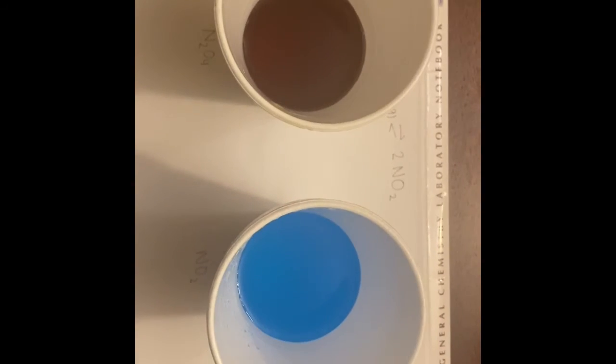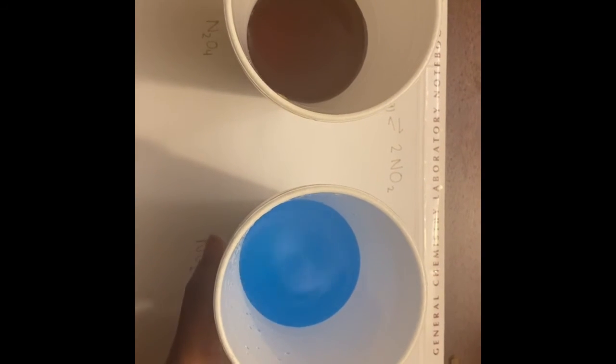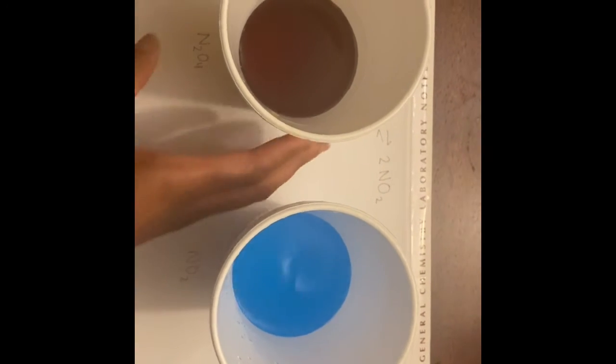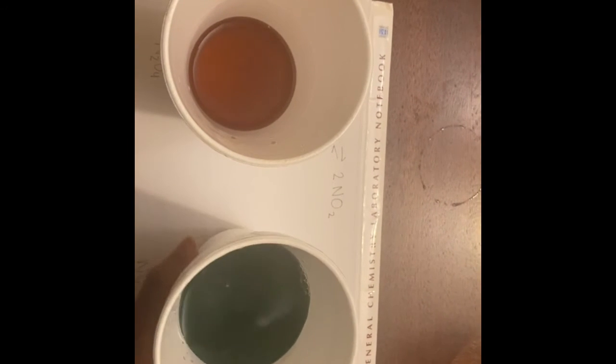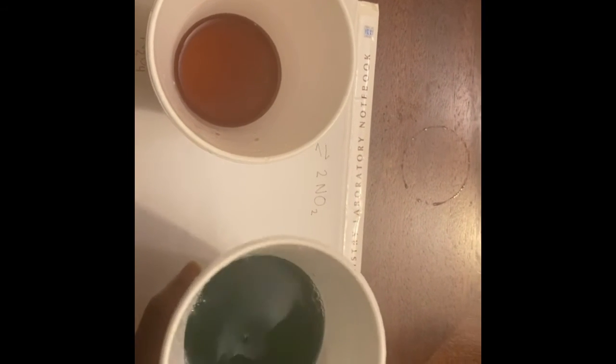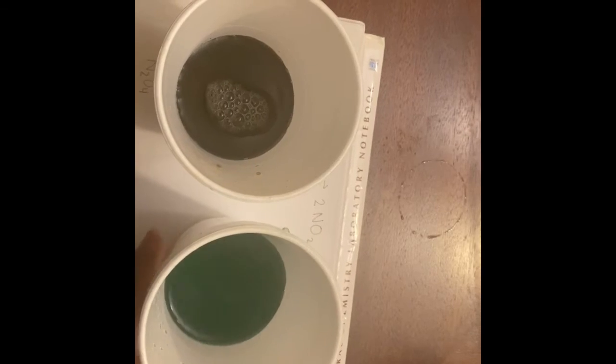So when the reactants and products are in equilibrium, there should be an equal amount, right? So that's the reactant, and we're going to use it to make the products, right? Notice how the color of the liquid turned this greenish color. And since the equation is at equilibrium, the products go back into making the reactants, right? And it just keeps going in the same process.